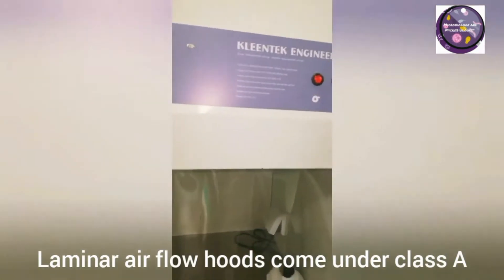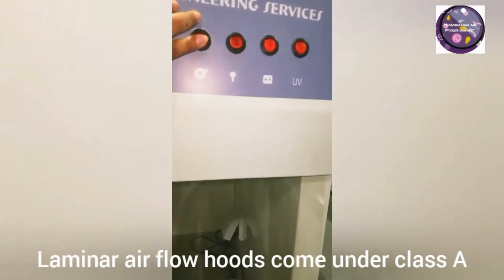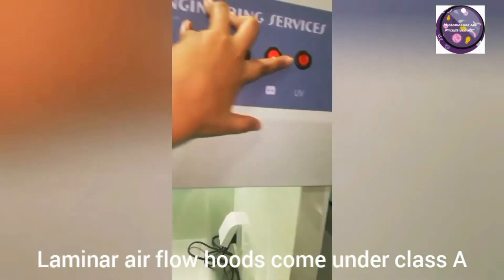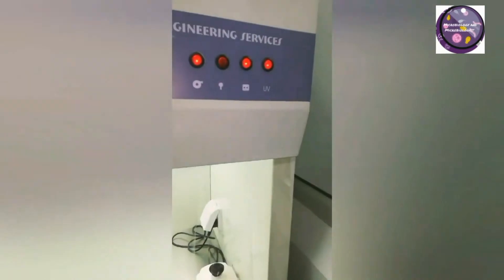As you already must know, laminar airflow hoods come under Class A. You can also see some functional buttons available for the fan, light, and so on.